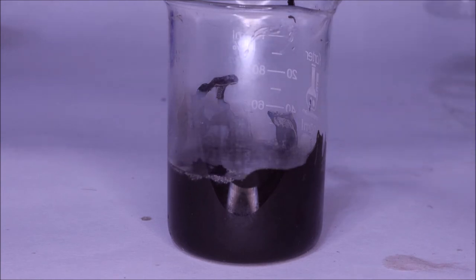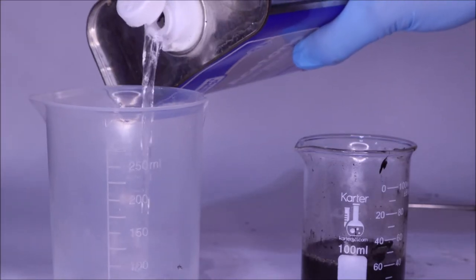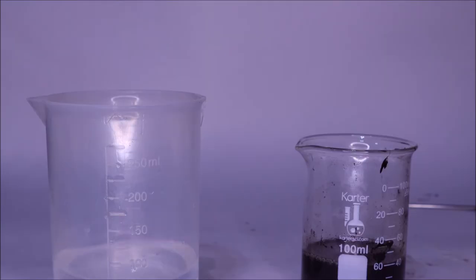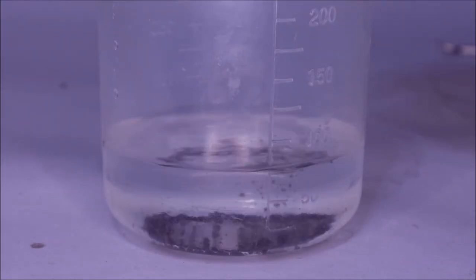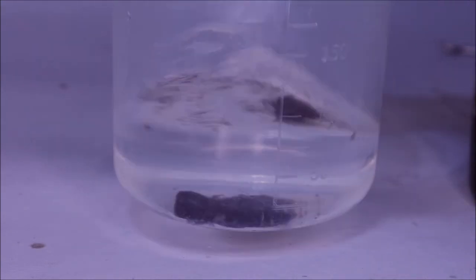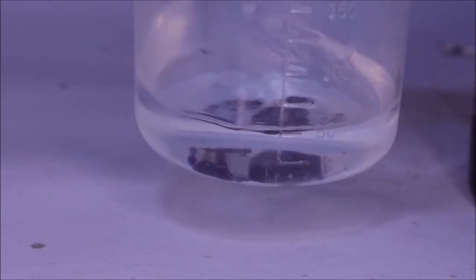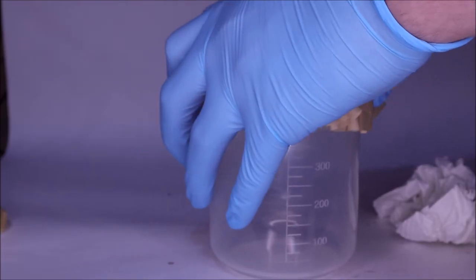I then added strong sodium hydroxide to this solution to try and deprotonate the amino acids that were hopefully present. From here, after they had been deprotonated, I could perhaps precipitate it in acetone so that the colored material would dissolve in acetone and the amino acids would remain in the water. When I poured it, it all kind of stayed together unfortunately. This is really unfortunate because I was hoping that this would be my ticket out.